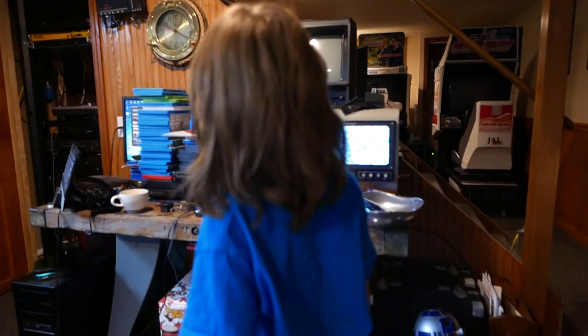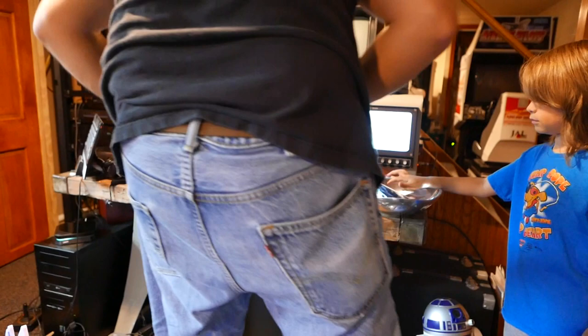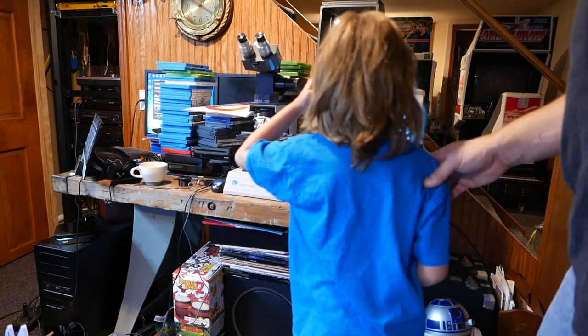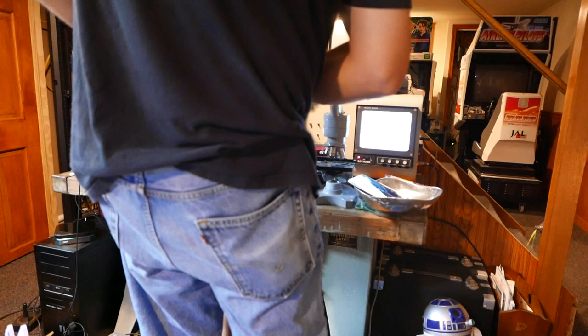Can I have a look through there? Absolutely. Hold on one second. I'm too small. You just put it a little too far back. The camera's not in the right spot. Closer up it looks better. Can you see through there? Yup. What does it look like? They look kind of like circle lines. We could have used this. That one's all plugged in there — want to try that one? Yeah, that one's about your size.